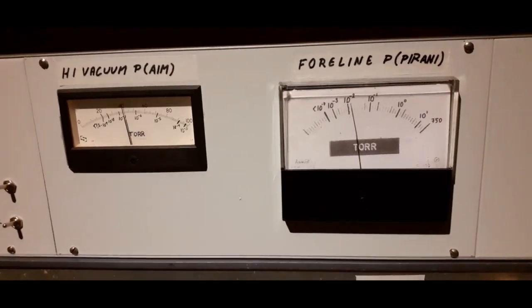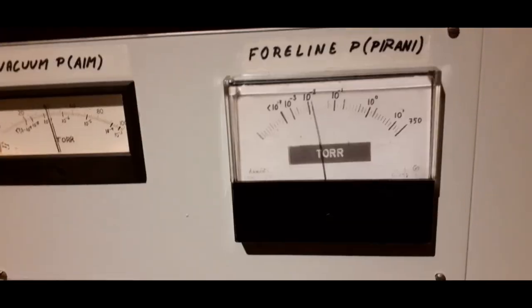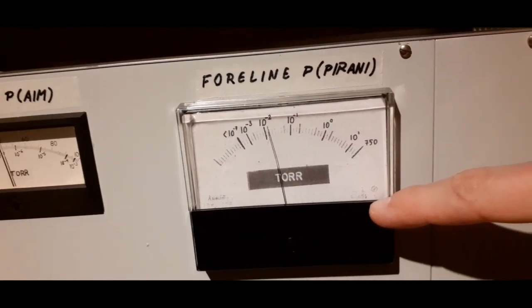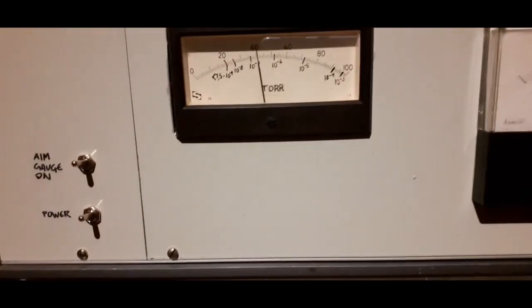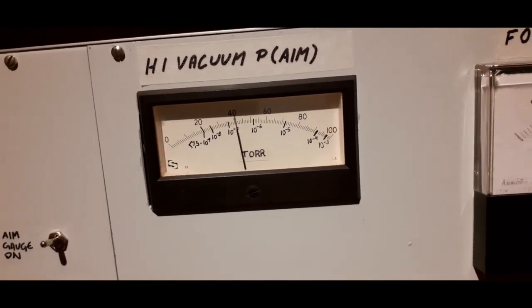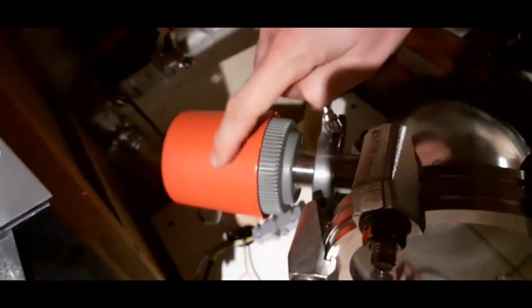Right, the turbo has been spinning for a few hours now, and as you can see, the pressures are looking pretty good. The foreline pressure here is almost 10 to the minus 2nd torr, which is really good. And the high vacuum, as you see here, is right about 2 times 10 to the minus 7th torr, which is also not bad at all, considering it's only been running for a few hours. That's this active inverted magnetron gauge sitting here.